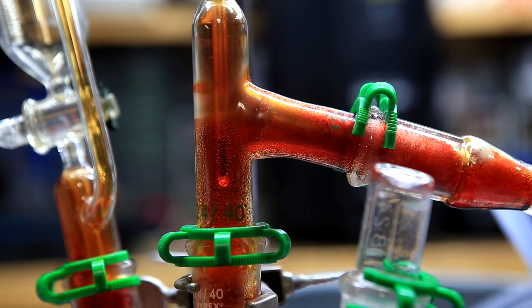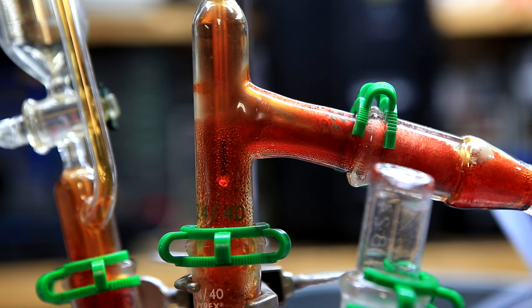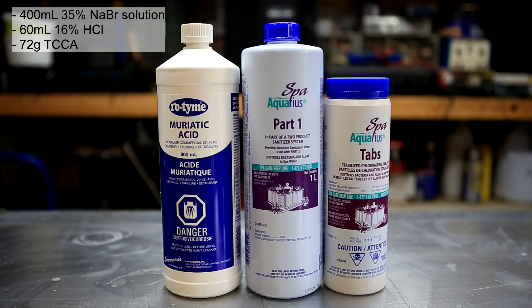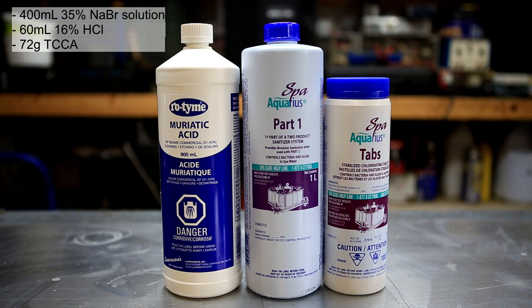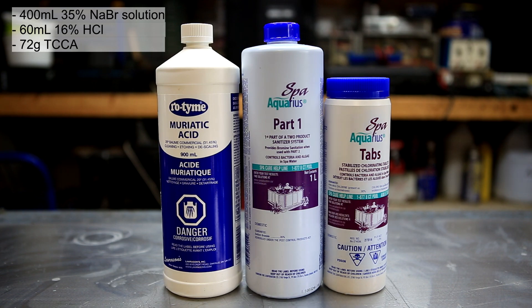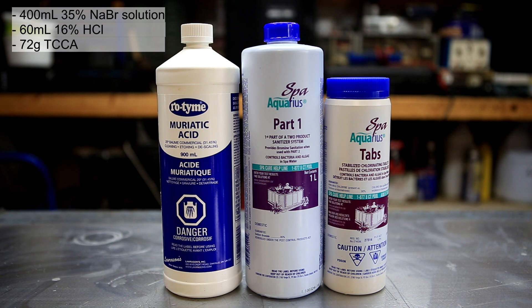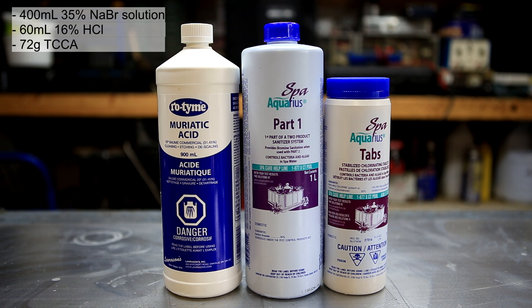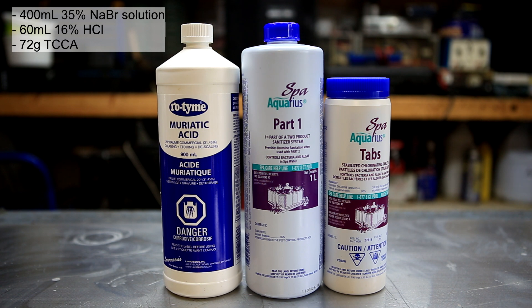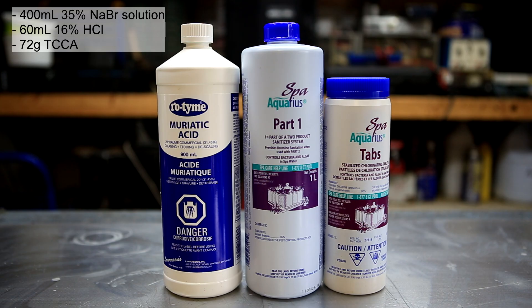This is very convenient because we're going to use pool supplies to make the bromine. To make the bromine, these are the three chemicals you'll need: muriatic acid, TCCA, and sodium bromide. The sodium bromide here is pre-dissolved in a solution, but you can also use powdered sodium bromide.